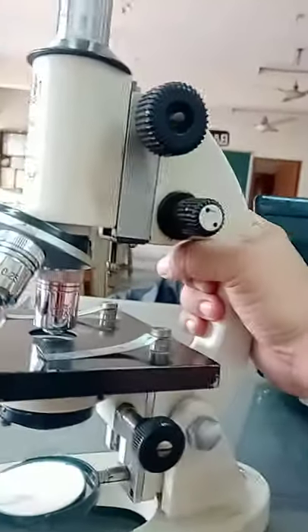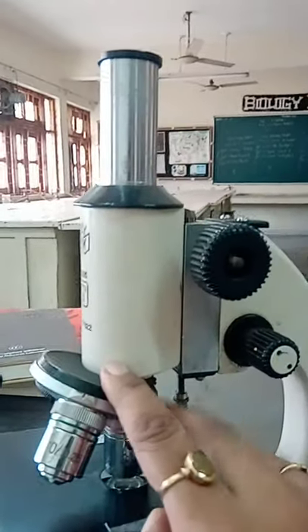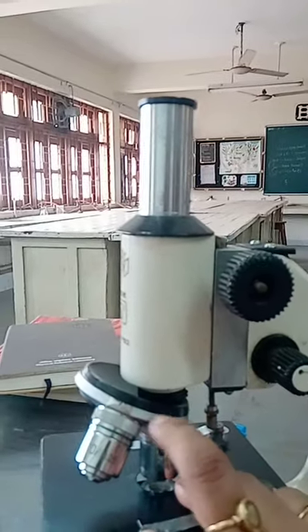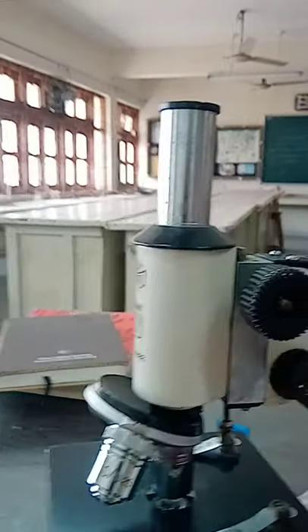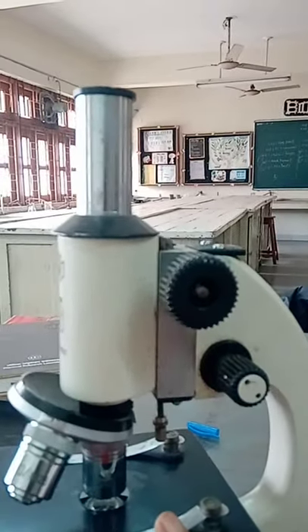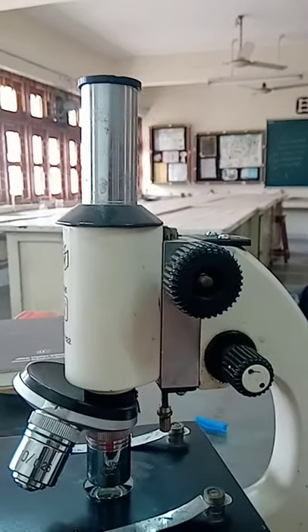Now let's talk about this hollow cylindrical structure. This is called the body tube. The body tube is the structure where we can attach our eyepiece and objective lenses to observe any material under the microscope.